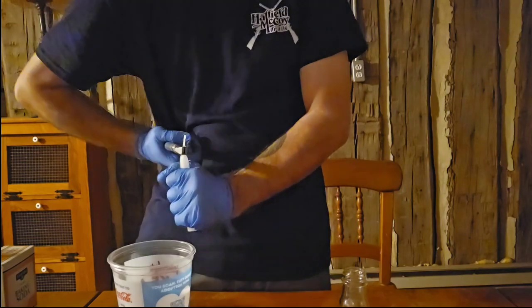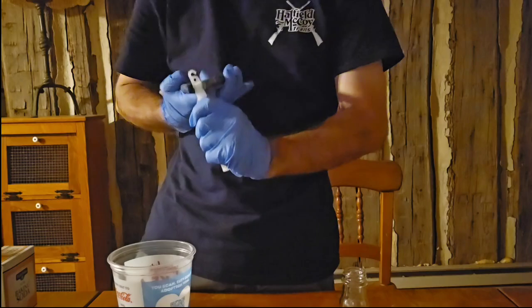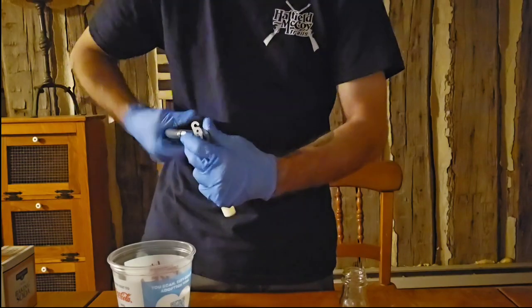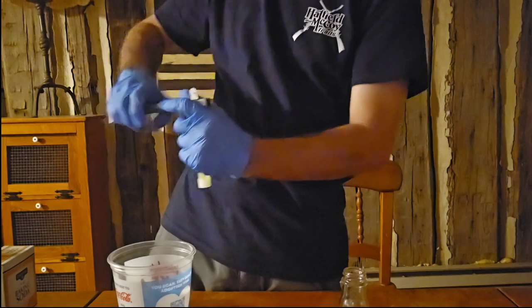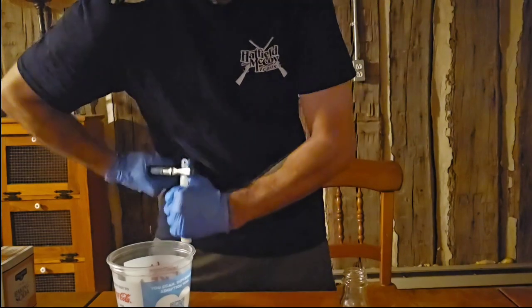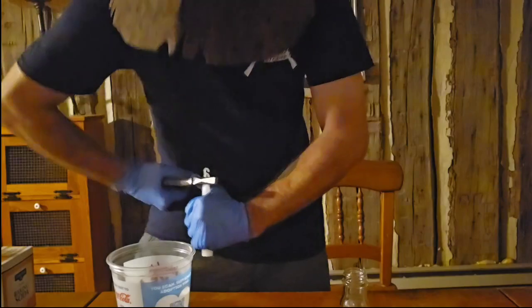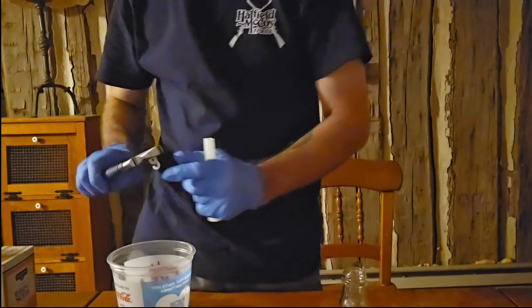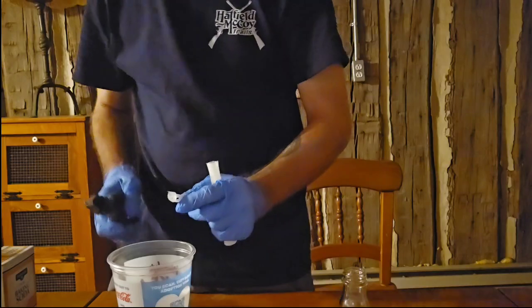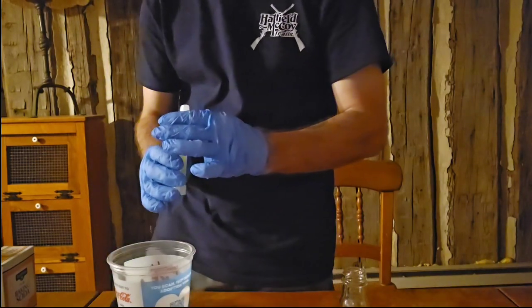Trying to cut that, if it'll cut through it. For some reason it seems to be a little bit stubborn, or I'm just too weak. One or the other. Probably both. Okay, there we go. I think I heard it crack. Crunch it. Okay, so this is crunched, right? I'm just gonna throw that in there as well because it's just gonna go to junk anyway.